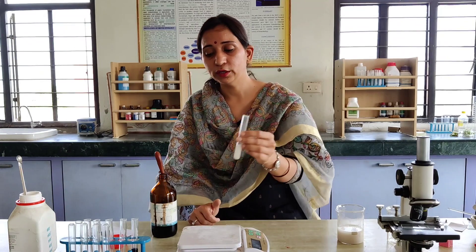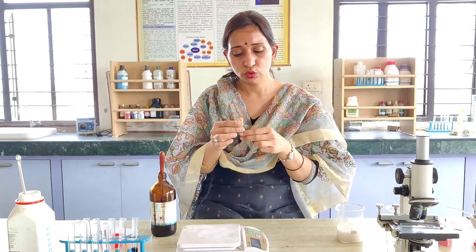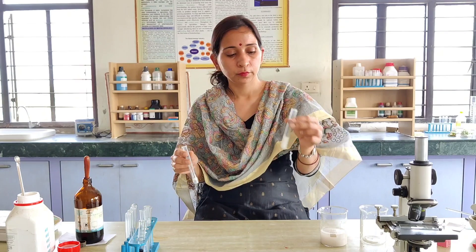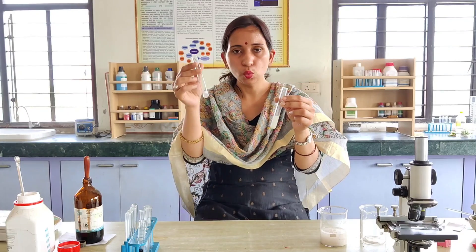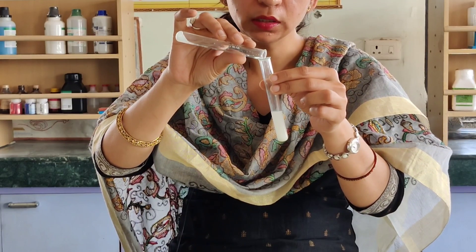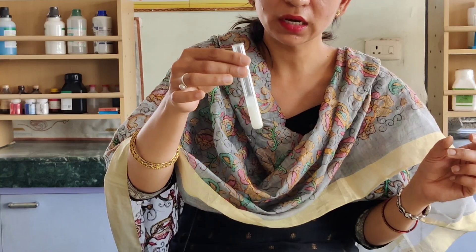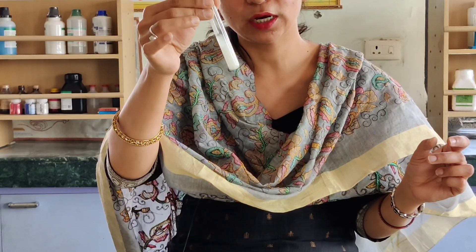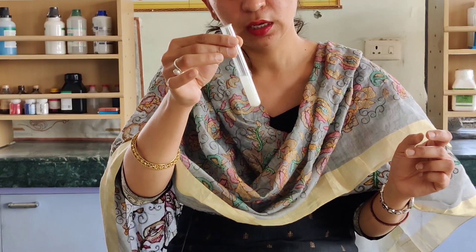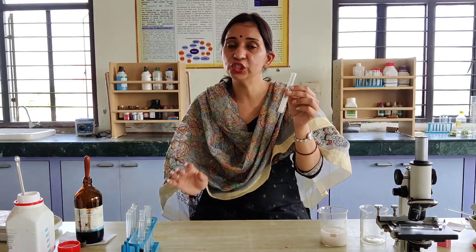Another option is to roll your tongue over your palate, which will cause saliva to collect in your mouth. Pour the saliva into a test tube to prepare the salivary amylase solution, then add this solution into the starch solution. The salivary amylase will act on the starch and degrade it into disaccharides. Let it sit for some time so the salivary amylase can perform its action.